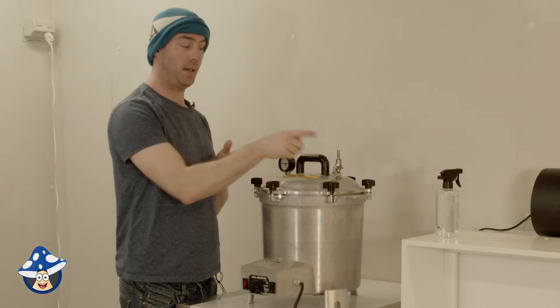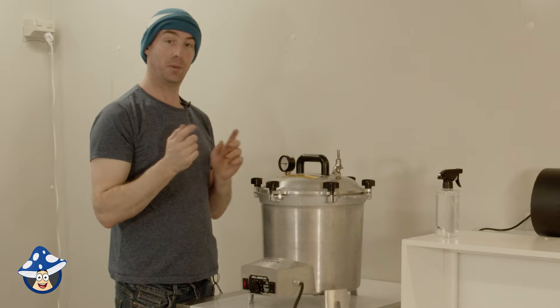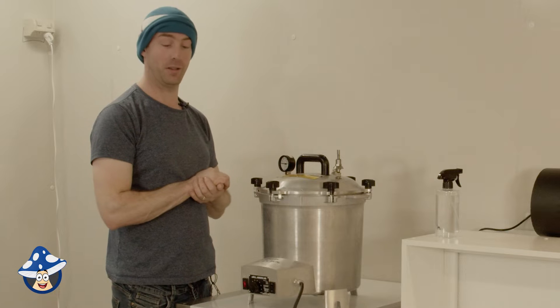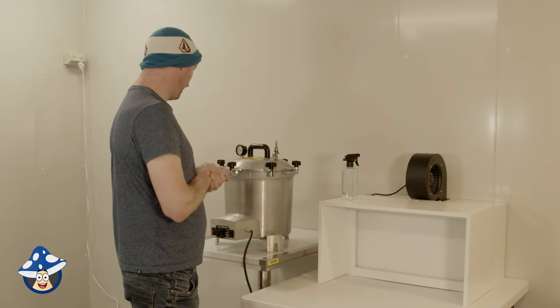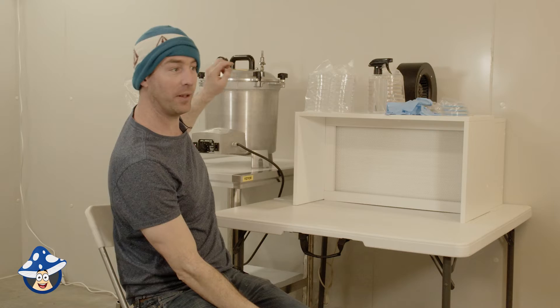When you've got it level, I do a little bit at a time. Each opposite ones, just to make sure it goes down flat. When you're warming up your sterilizer, most important thing is having your vent open to warm it up and vent it. We'll check back in shortly when it starts to steam and we're ready to close it. Now we've got like 50, 60 minutes, so it warms up.